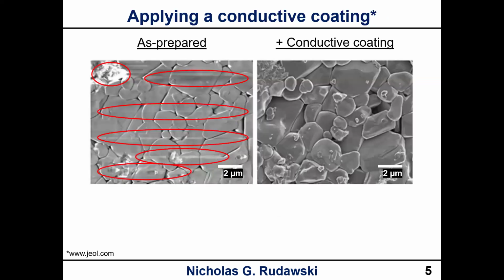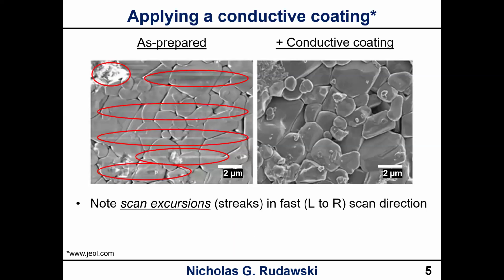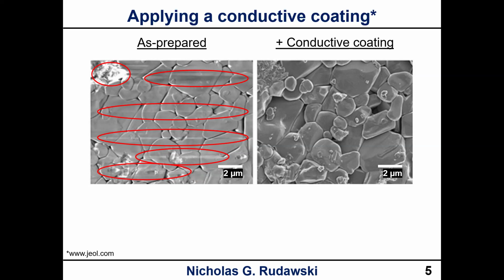So yeah, coating's there. Okay, so if you look on the left here, in the case of an as prepared sample that doesn't have any conductive coating, the ellipses indicated in red are where we have what are called scan excursions to the beam, okay? So you can see in this case, because the fast scan direction is from left to right as the beam is moving from top to bottom through the image. So we see these things in a charged sample called scan excursions, which is basically a disruption to the scanning sequence, okay? And obviously this isn't good, right?